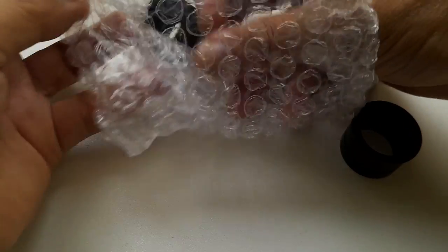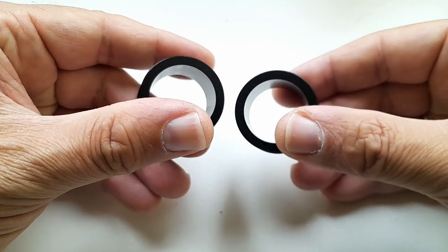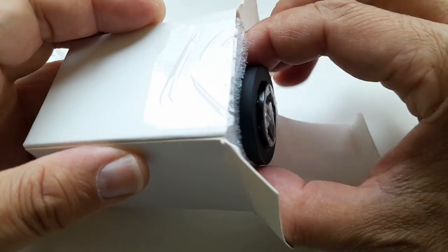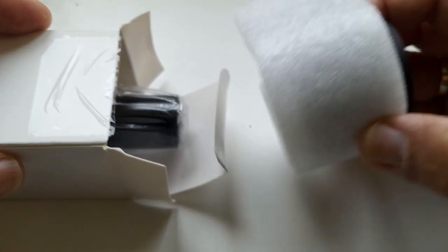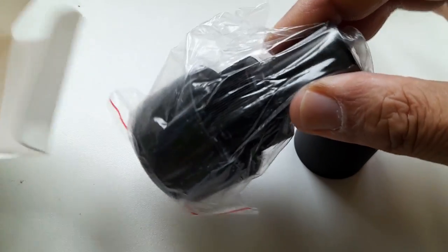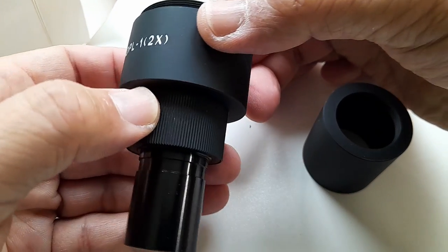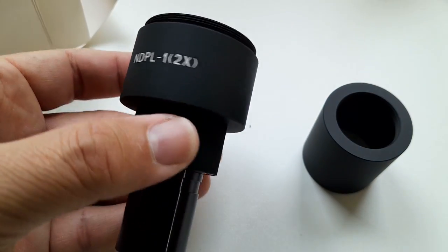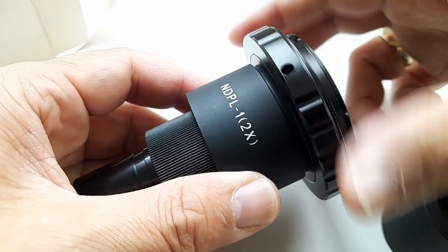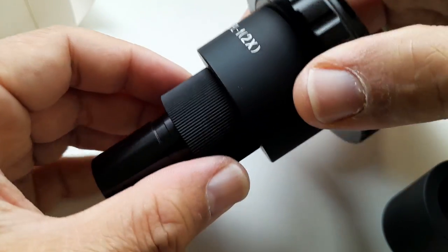And these two adapter pieces here are for stereo microscopes, because stereo microscopes, they have a slightly larger eyepiece diameter. And in order to fit the DSLR adapter into stereo microscopes, you need to have those specific adapters as well. This tube here, I don't know what it does. I'm going to look at it later a little bit in more detail. And this here is now the actual adapter. Yeah, it is pretty well made, I would say. Pretty solid, aluminum, metal, no plastic parts. The T2 adapter ring goes on it. Okay, and actually we're ready to go here.